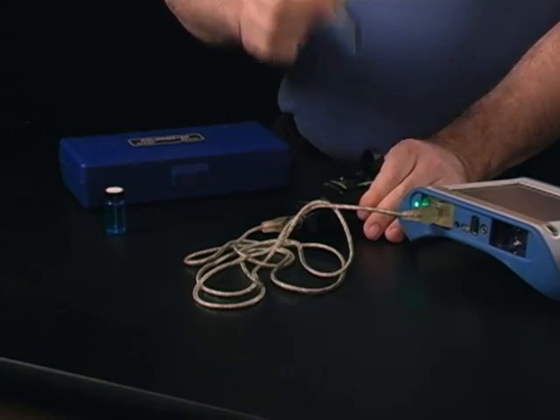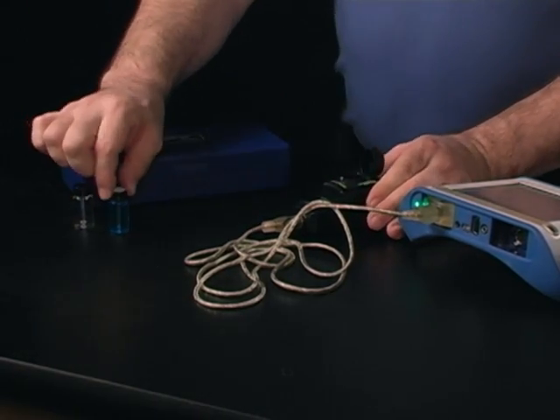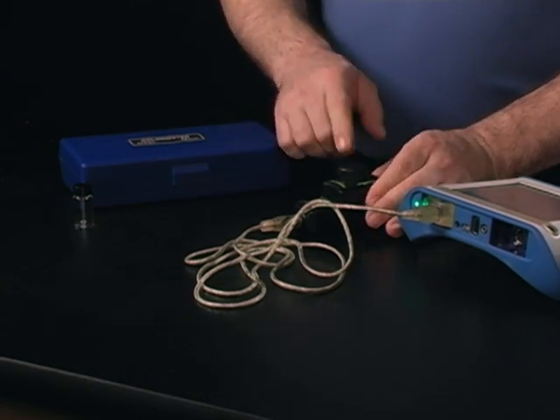I'm going to go ahead and remove my distilled water. Now I can take samples and I can place them in there and see how the light is absorbed or transmitted through that sample.